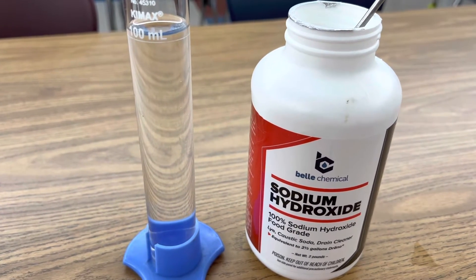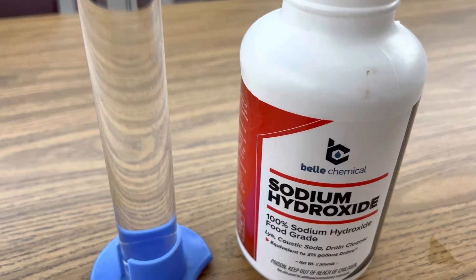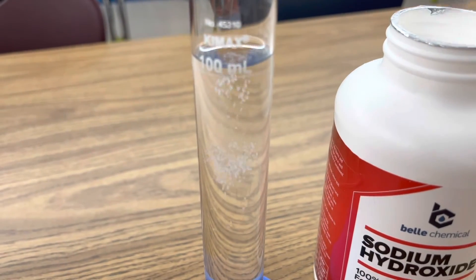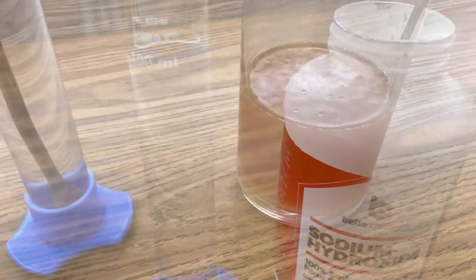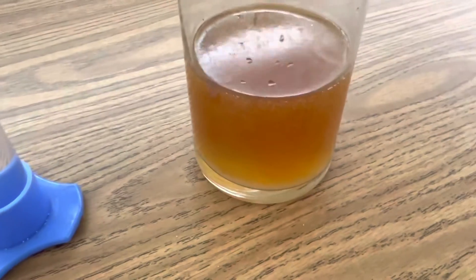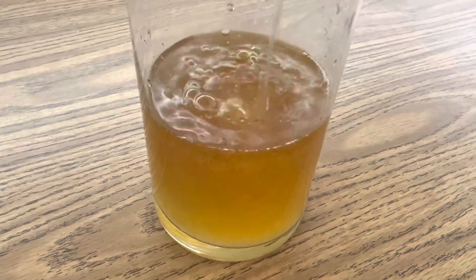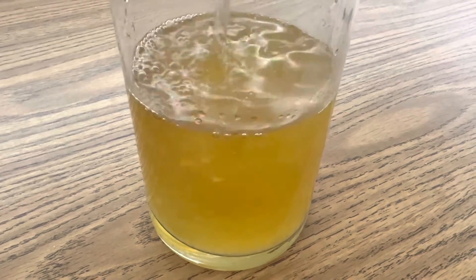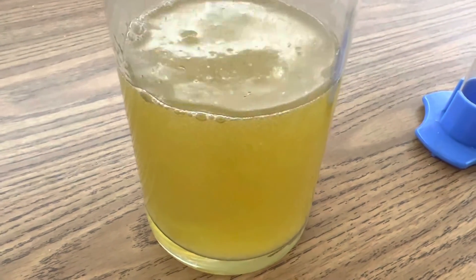Next, you want to step down your solution. If you have any hexavalent chromium, you definitely want to step that down. I'm going to use sodium hydroxide to do that — this will just be an acid-base reaction. I'm going to add 4 grams of sodium hydroxide to 100 milliliters of distilled water and create an aqueous solution, then slowly add it to step down your hexavalent chromium. You'll see the color change as it's neutralized. This is just to safely dispose of your hexavalent chromium.